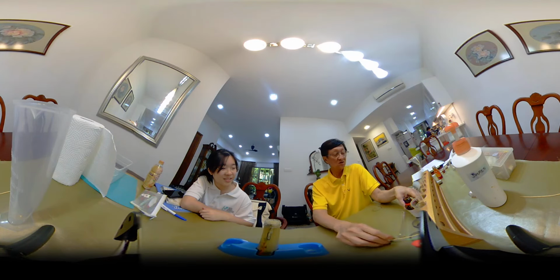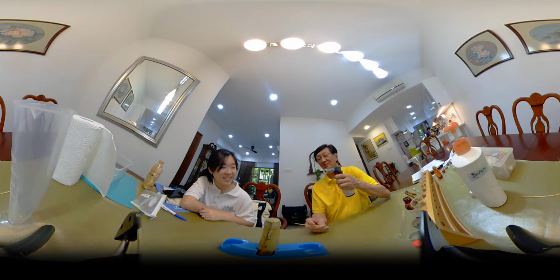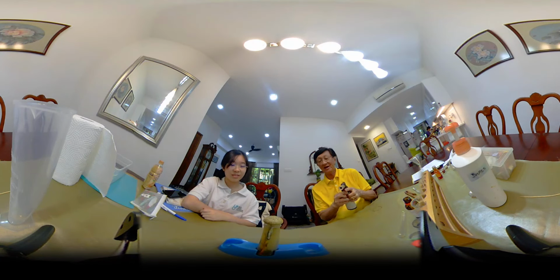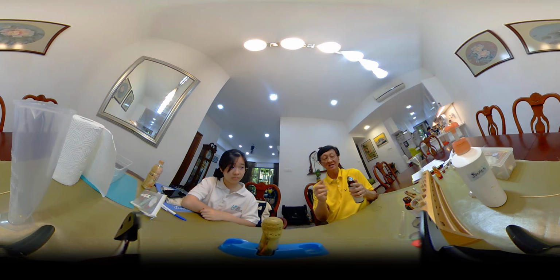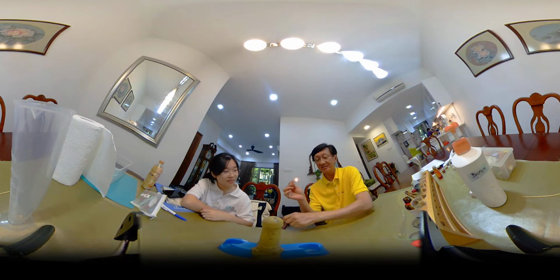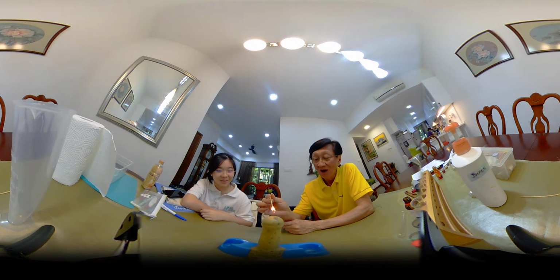It's rising. So what is actually happening? What do you think is happening? The oxygen is trapped in the bubble. Okay? The oxygen is trapped in the bubble. And therefore, if I were to put this inside, what do you think will happen? Flames. I don't know.